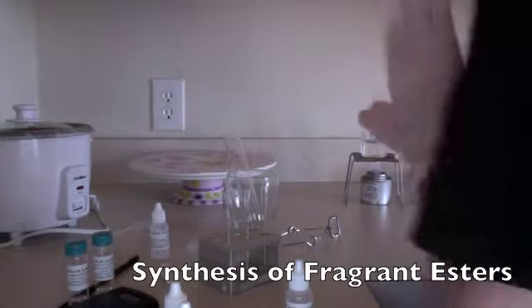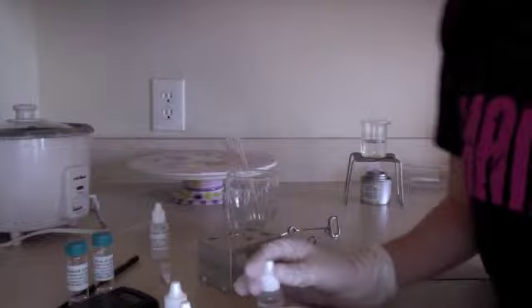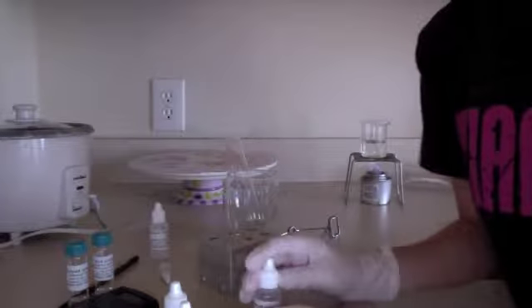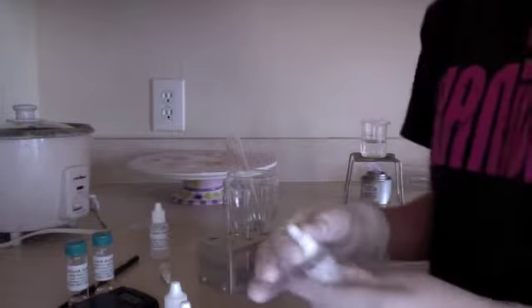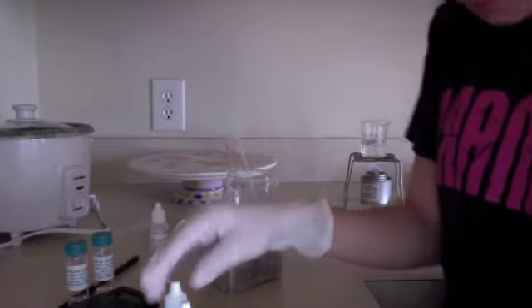This is the synthesis of Fragrant Esters Lab Part 1. First off, we've already prepared our data table and we've marked our test tubes 1, 2, and 3. First off, we are going to place 4 drops of acetic acid into each test tube.